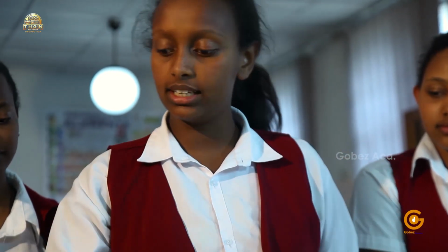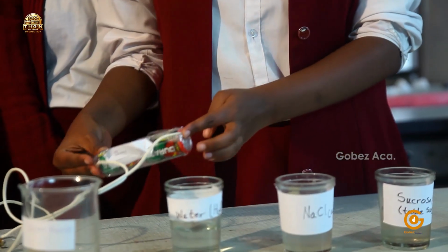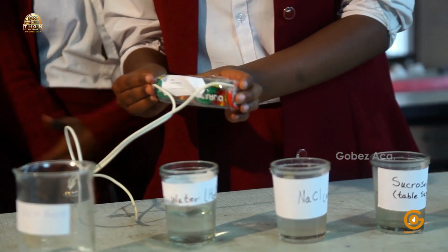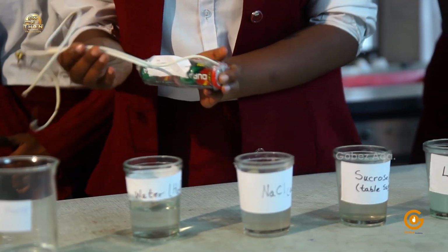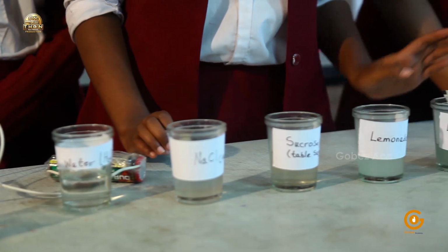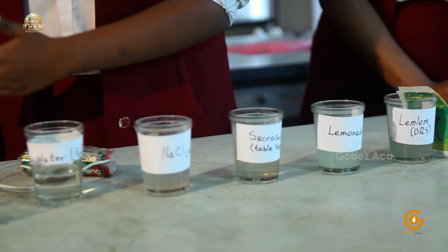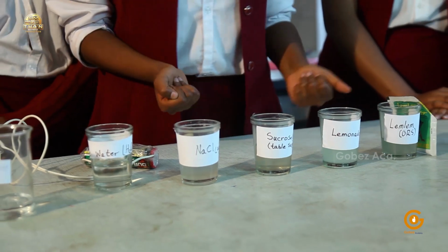To demonstrate today's experiment, we'll be using this apparatus. It is simply a couple of battery dry cells connected by a copper wire to a bulb. So we'll be checking whether the compounds we have in front of us are covalently bonded or ionically bonded by the fact that they light the bulb, because they will have free ions within them.